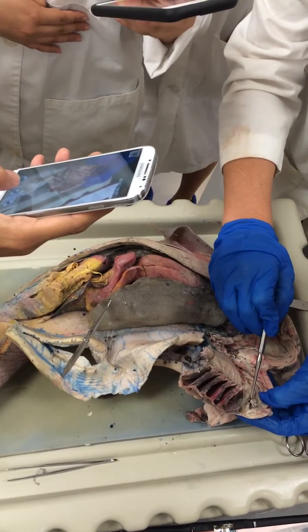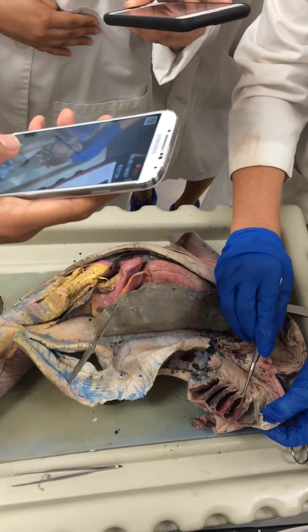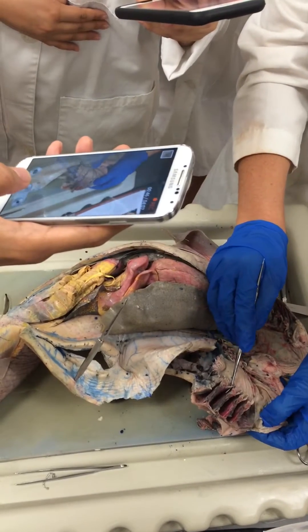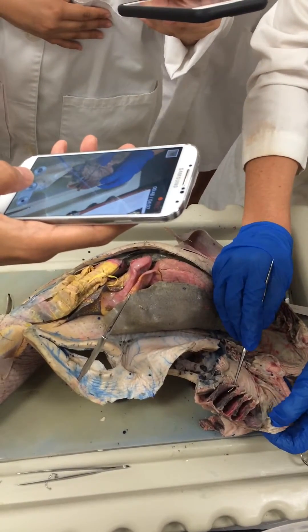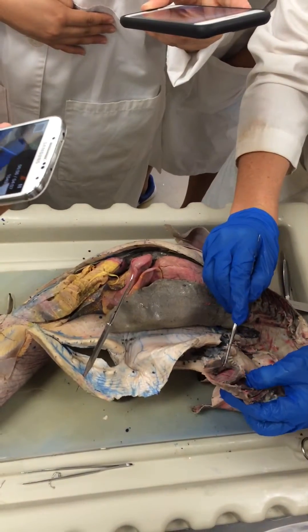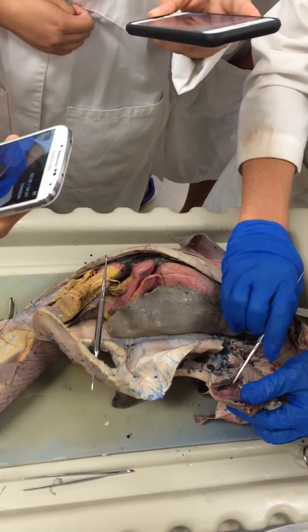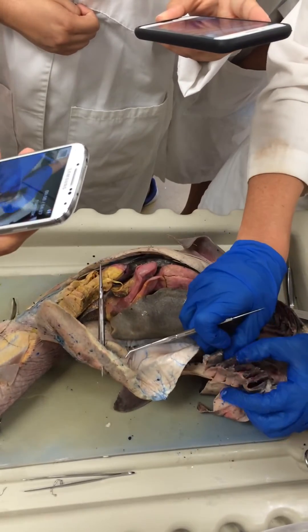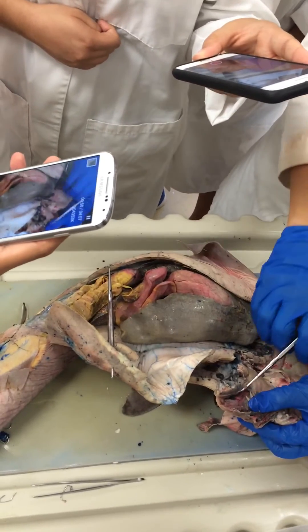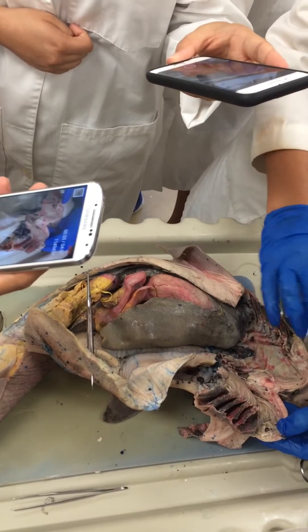The first one is actually associated with the spiracle and is pretty modified. The second, third, fourth, and fifth gill chambers are called holobranch gill chambers. This last one is called a hemibranch gill chamber because it only has the gill filaments on one side of the gill chamber. The last one is a hemibranch, and also the first one associated with the spiracle is also hemibranch — only has gill filaments on one side.